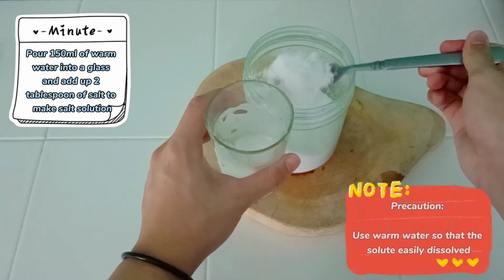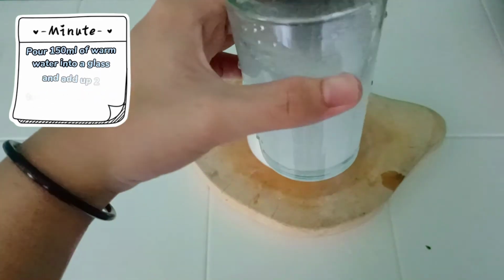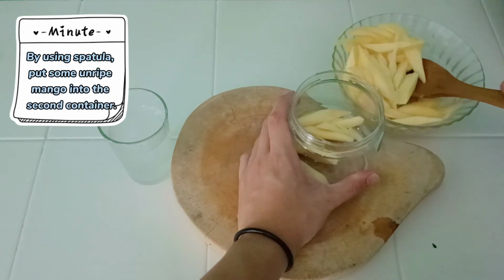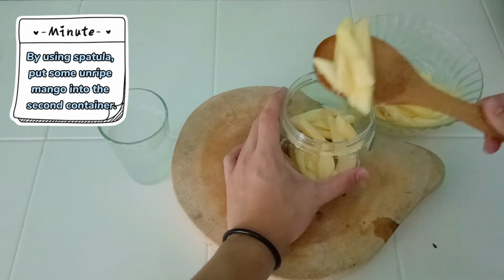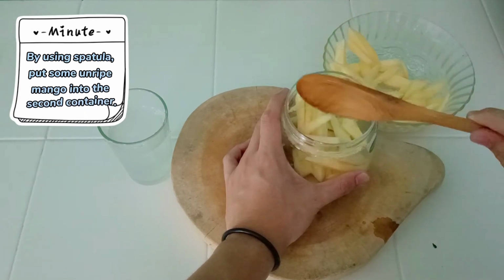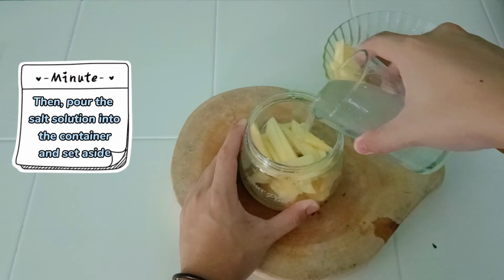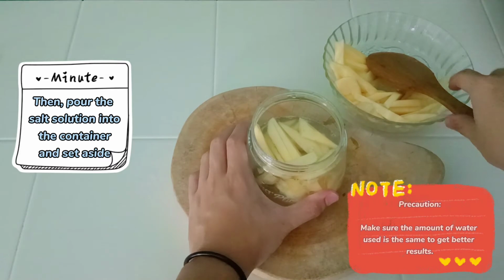Precaution: use warm water so that the solute easily dissolves. Precaution: make sure the amount of water used is the same to get better results.